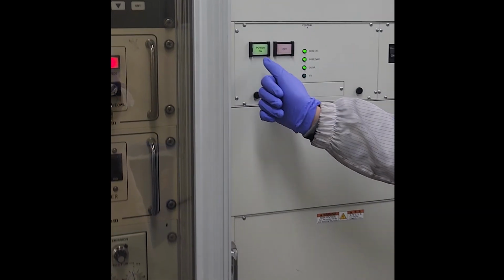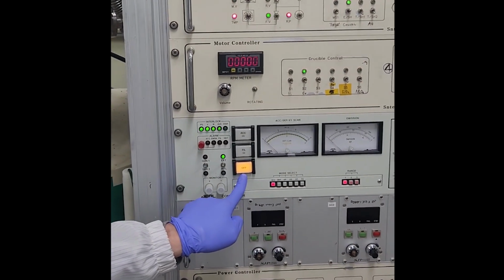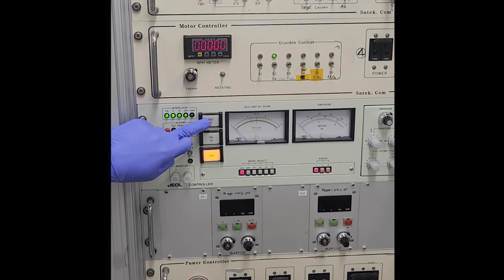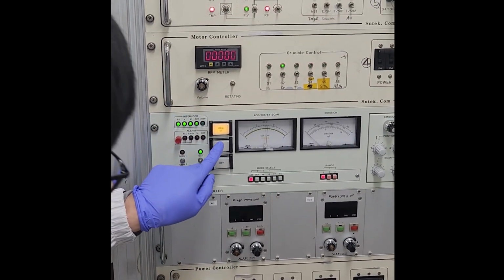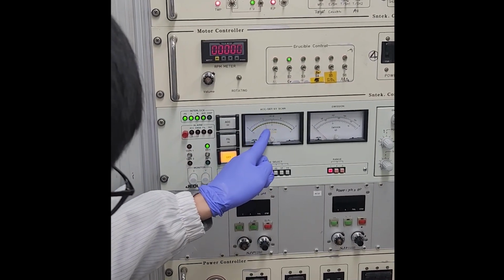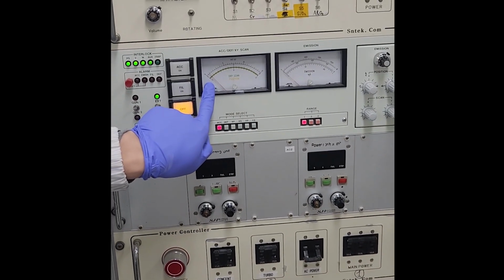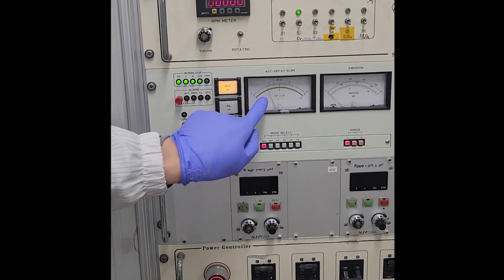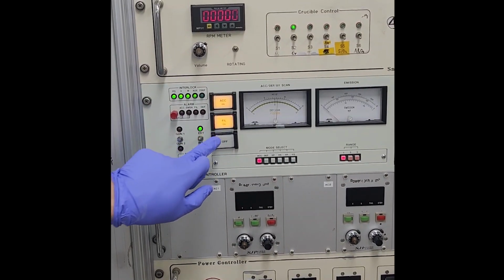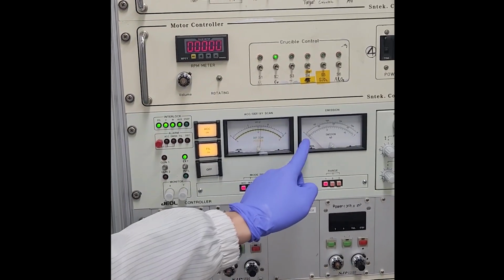And you can see the system is already off here. And then acceleration. Click this one, choose this one, open. You can see it go to -2. You need to wait several seconds, and this one is controlled by emission.